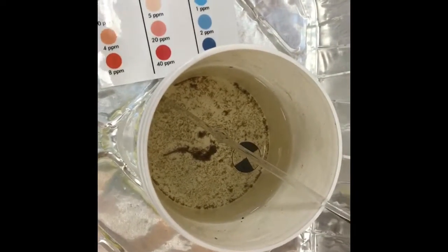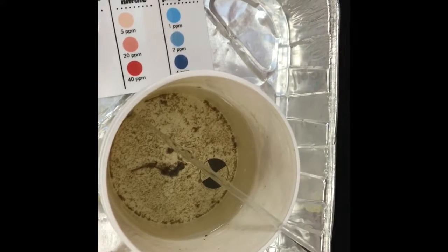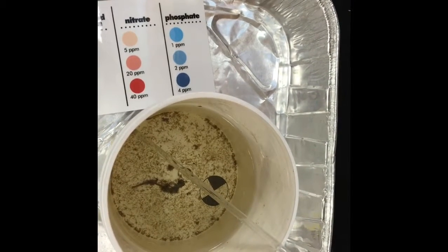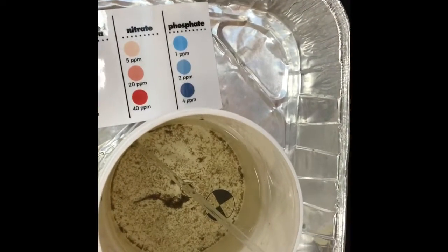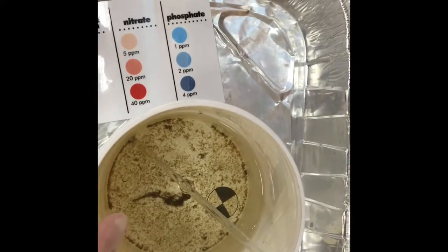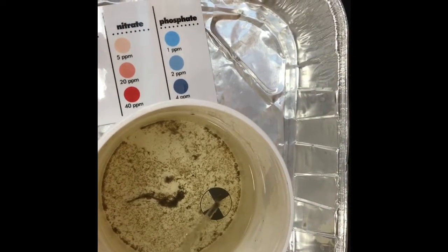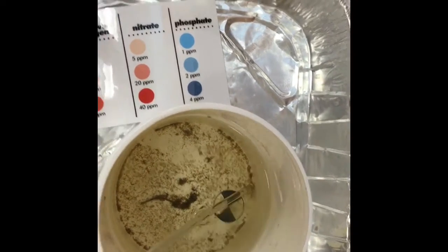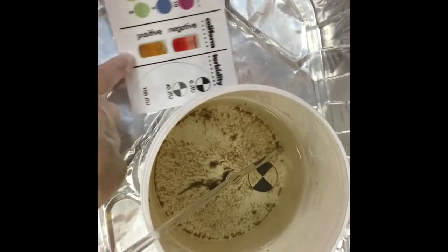Another test we did was for turbidity. Turbidity tells us the relative clarity of the water. Water that is turbid has a lot of suspended particles like dirt and sand, which can block sunlight and make it hard for plants to perform photosynthesis, putting less oxygen back into the water. This water sample from the orange bucket has been sitting still, so the sediments have settled. We need to stir the sediment to get it to suspend in the water and compare it to the turbidity section on our card.